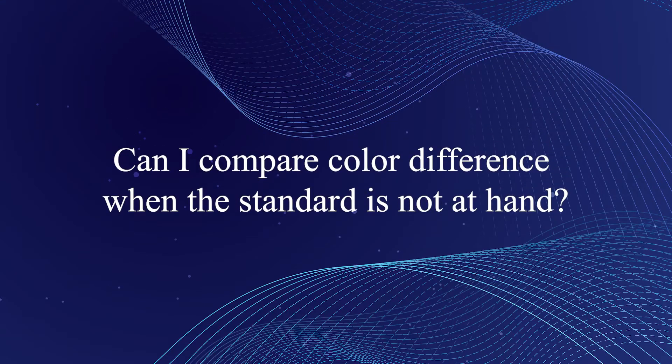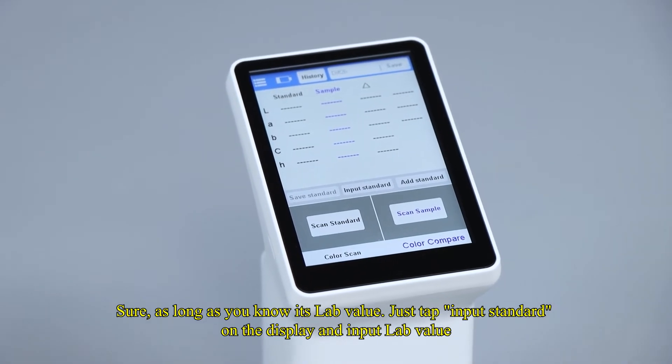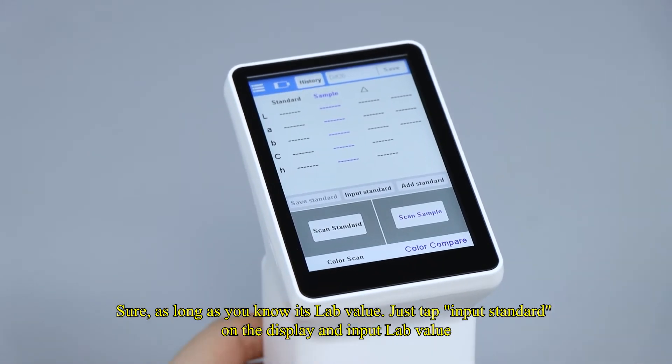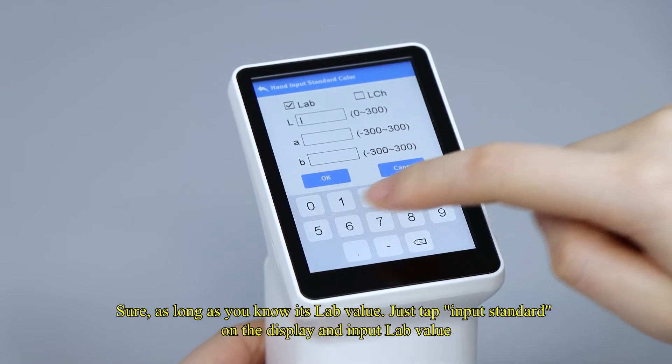Can I compare color difference when the standard is not at hand? Sure, as long as you know its LAB value. Just tap input standard on the display and input LAB value.